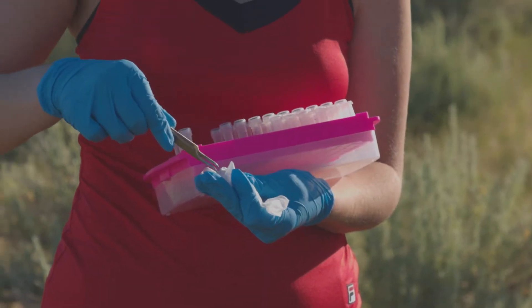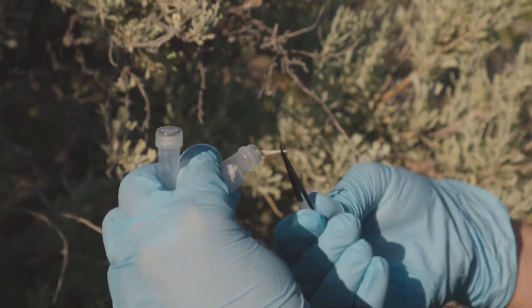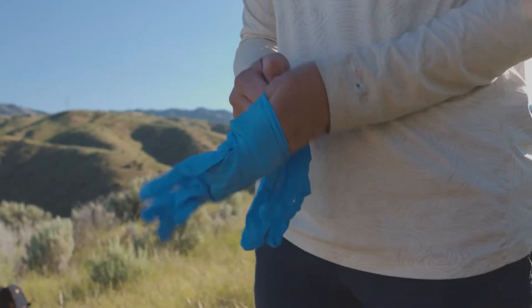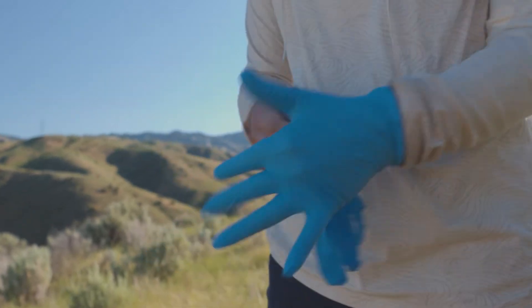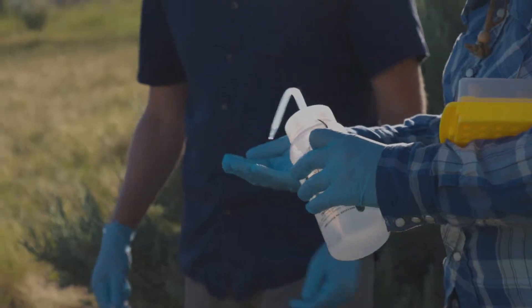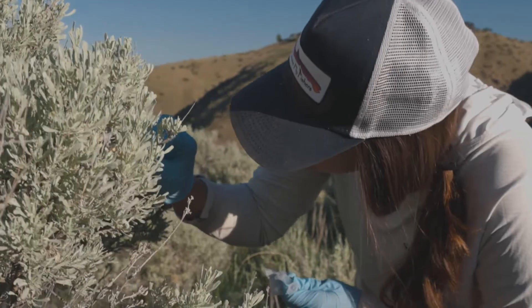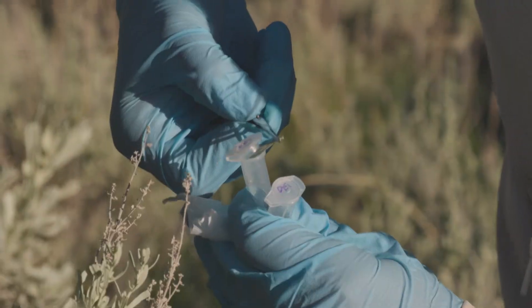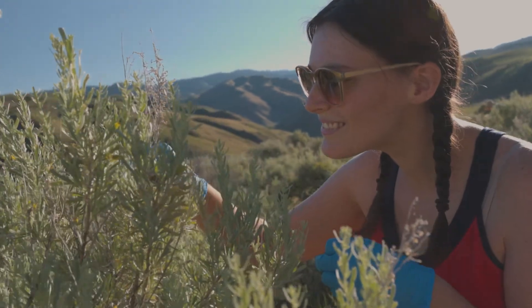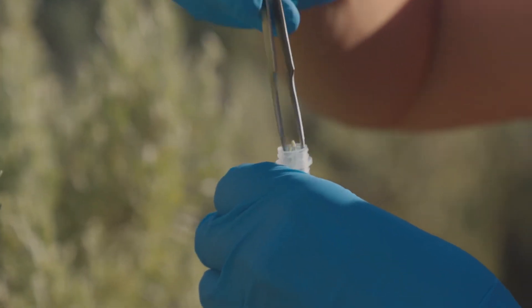We have our supplies here — little tubes that we use to put our microbial leaf samples in, and those are all sterile. We have nitrile gloves that we're using to make sure that we're not adding our microbiome to the plant microbiome. We use ethanol to clean our gloves and to clean our forceps in between sampling to make sure we're getting just that individual microbiome for that individual leaf.